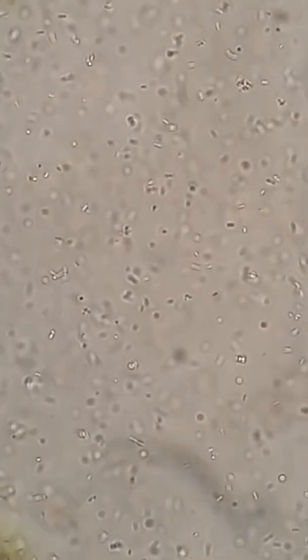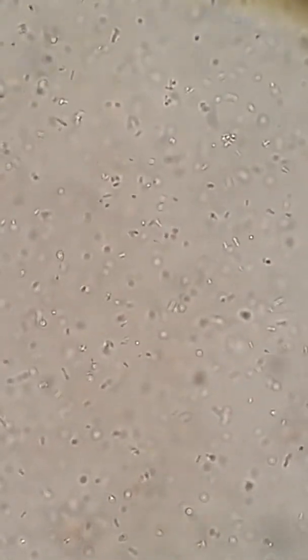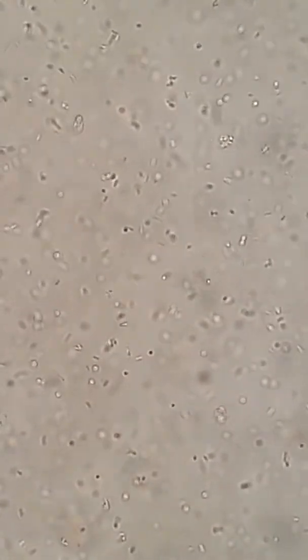And so as far as dilution, it's in a capsule so I had to pop the capsule open and use a little bit of the powder and mix it with water. So I really don't know how to tell you how much I diluted it. I just took a tiny pinch of the powder and I added water to it and I shook it up, just a gentle little mix up, and I took a drop of that solution and this is what you're seeing.